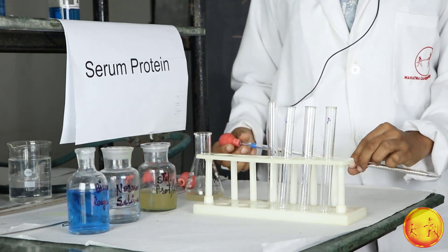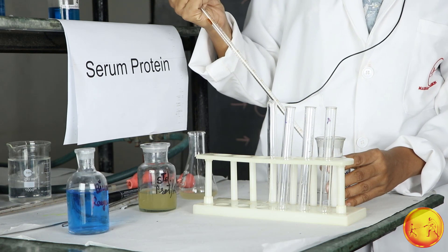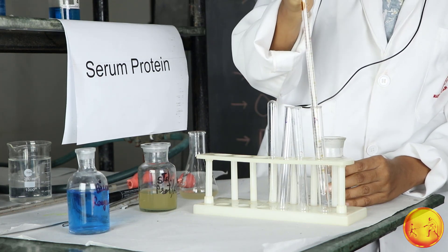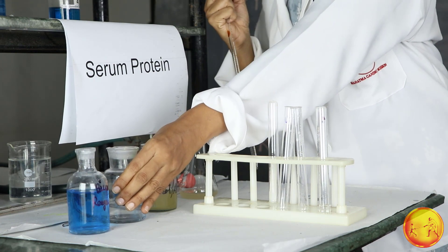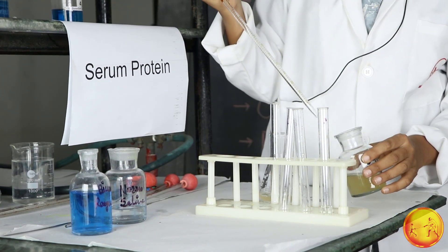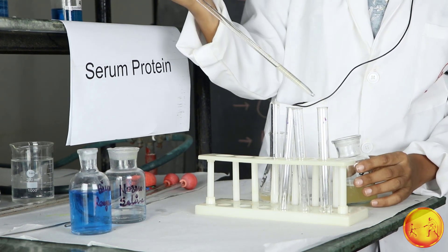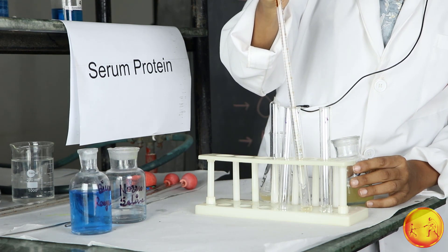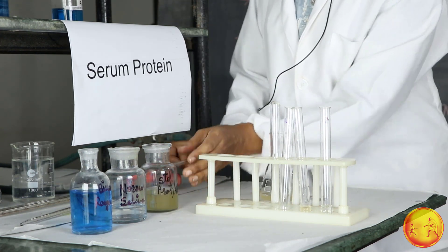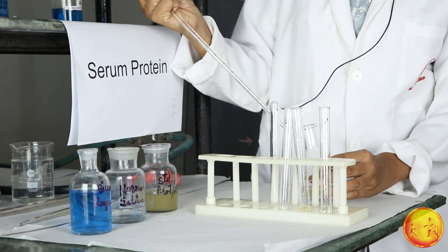Now we will add the solutions. In blank, we will take 1 ml of normal saline. Then we will take protein standard solution in the standard tube. And we will take 1 ml of diluted protein in the unknown tube.